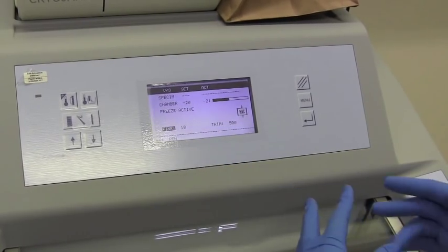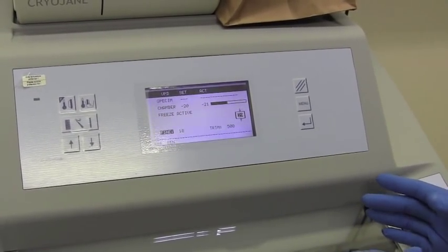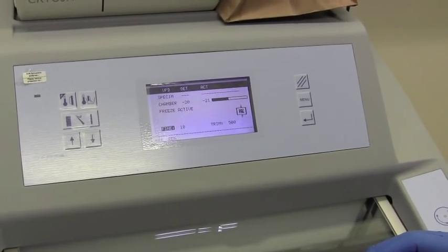If you're going to mount it for imaging, if you're going to do some dyeing and staining of tissue, you could go up to 25 or 30, and you could still get a pretty good picture on the confocal.